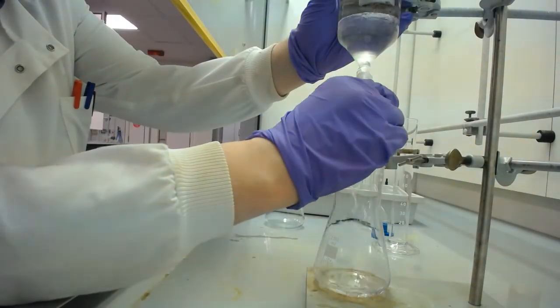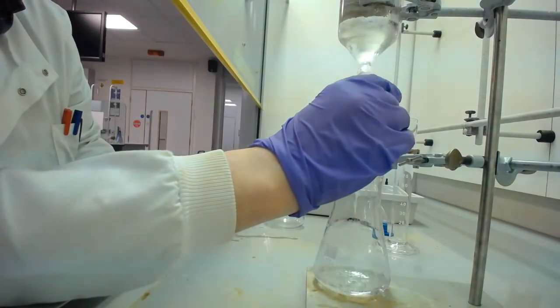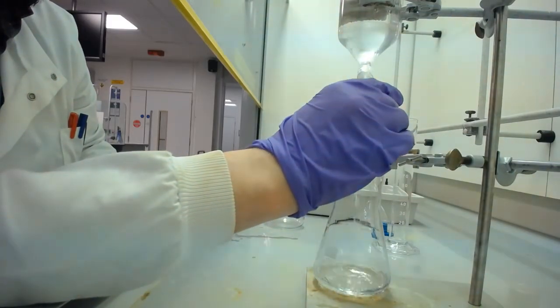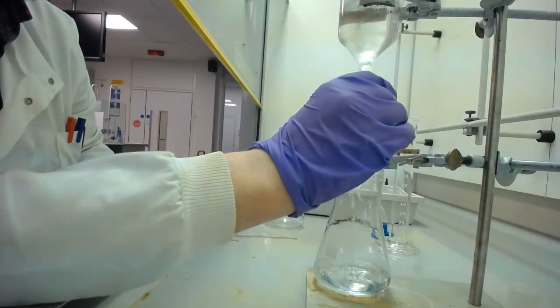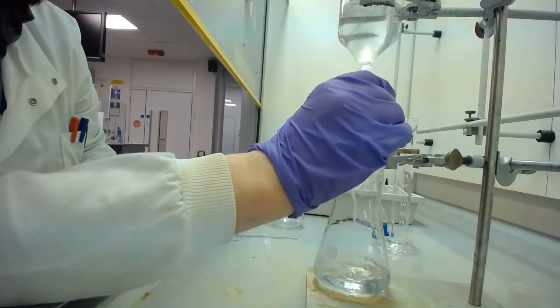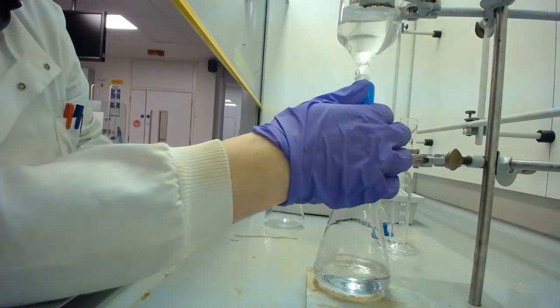Do also make sure that you take the lid off, otherwise you get that gloopy action that I just had there. So we're draining off the more dense phase. Now remember, you can look up specific densities and make sure you know which phase is which, because we don't want to be putting the DCM into a plastic cuvette to take its absorbance reading.